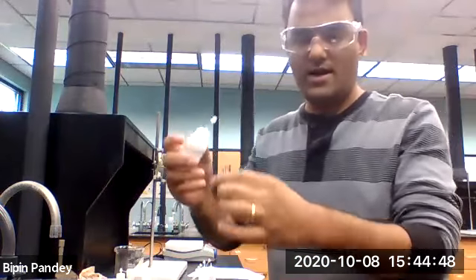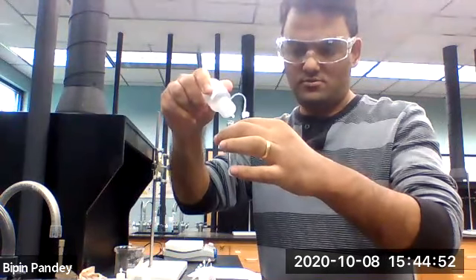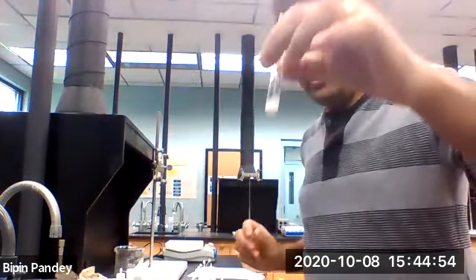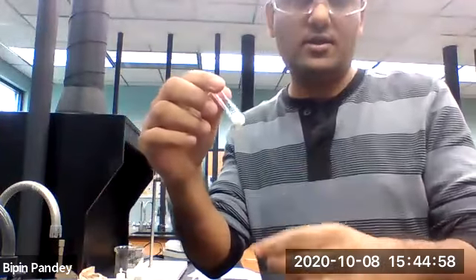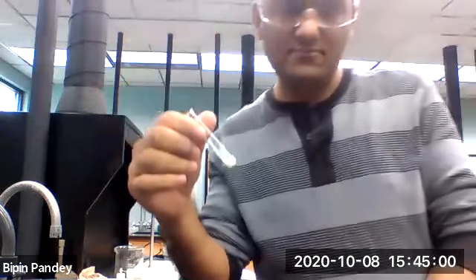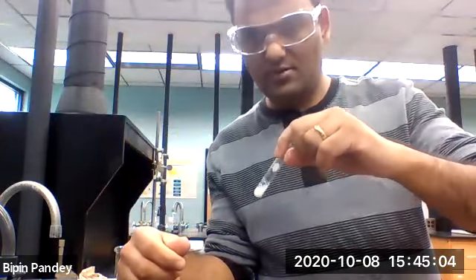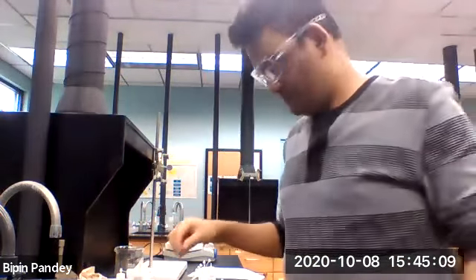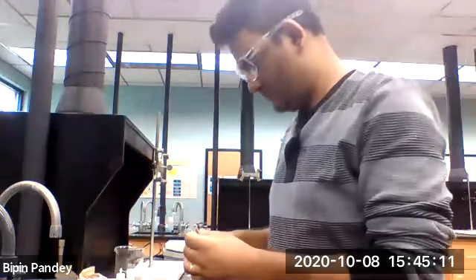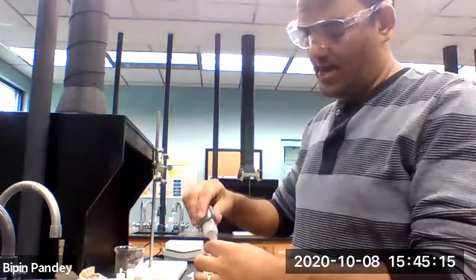Let's add bromide to it. Again, silver bromide is also white. I see white solid form. Okay, so white solid. Let's add iodide to it.